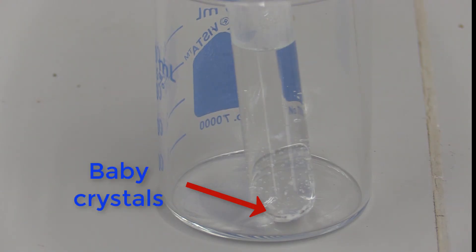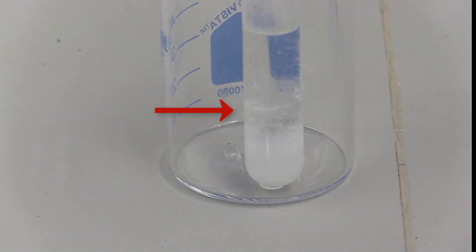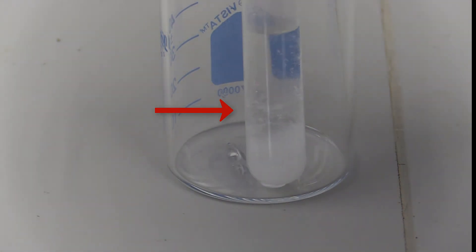Cool the tube or tubes to room temperature and wait for crystals to grow. If a precipitate forms, use this solvent and recrystallize your unknown on a large scale. Do not use a solvent that doesn't result in a precipitate.